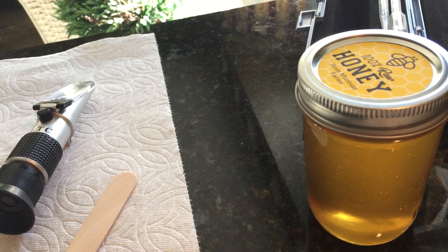We've got a probably mid-summer harvest — just a small harvest, a little bit of honey. But the question was asked of me about the moisture content of the honey.